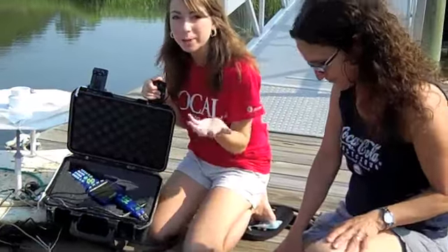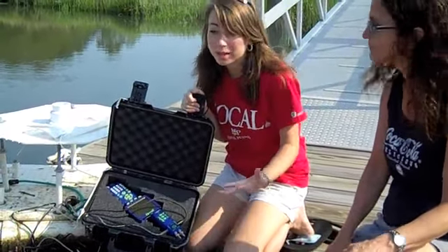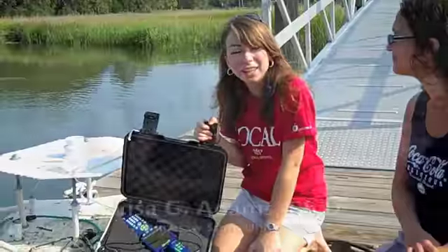Well, we plug it into a computer, and the computer takes whatever data is on here, analyzes it and puts it in a graph. And then as a class, we discuss the graph, and we go through all the data that we've collected. We look for trends in our previous week and the week that we just collected. It's pretty interesting to see how it can change, how it can fluctuate.